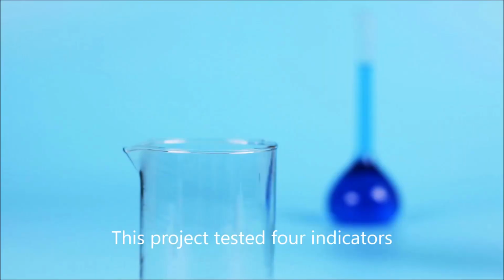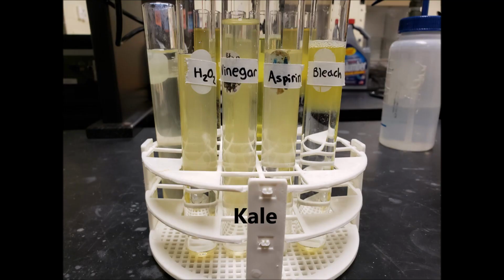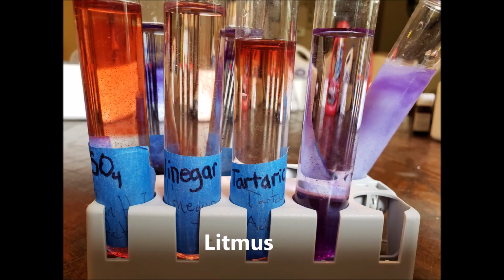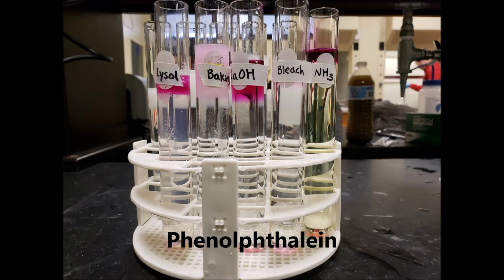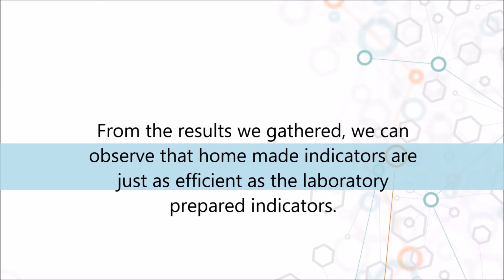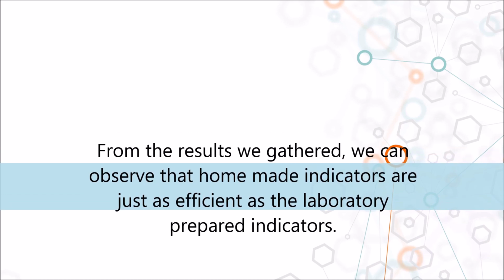This project tested 4 indicators, 2 of which are homemade indicators, the red cabbage and kale, and 2 of which are laboratory prepared indicators, litmus solution and phenolphthalein. From the results we gathered, we can observe that homemade indicators are just as efficient as the laboratory prepared indicators.